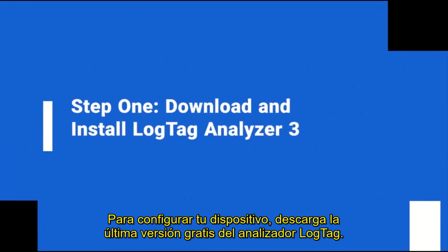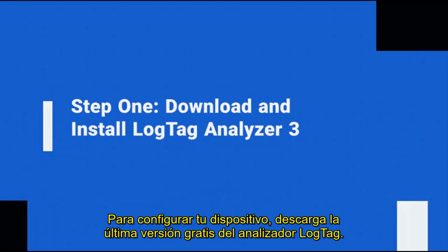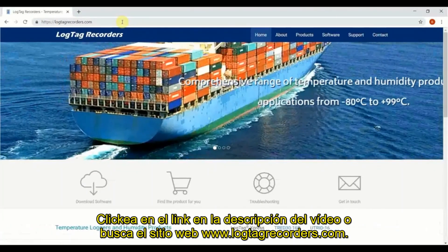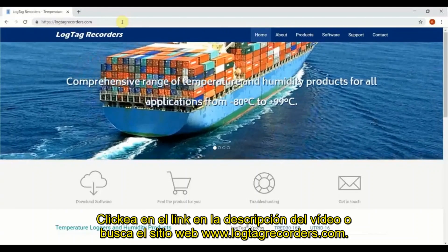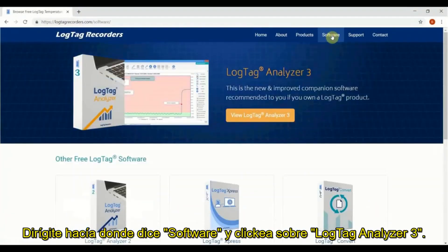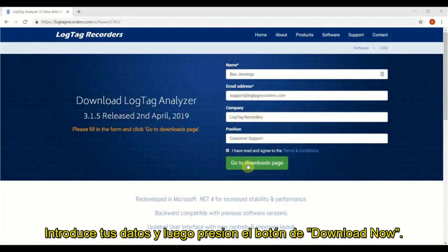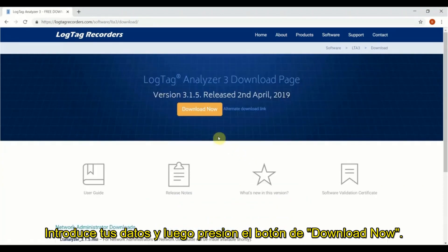To configure your device, download the latest version of our free LogTag Analyzer software. Click on the link in the video description below or browse to our website at LogTagRecorders.com. Navigate to Software, click on LogTag Analyzer 3, enter in your details, and finally click Download Now.